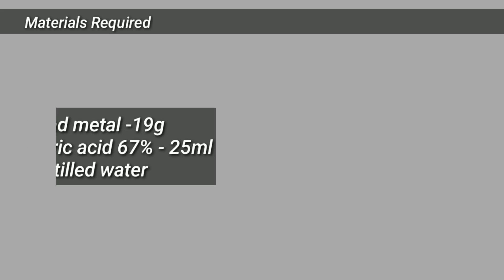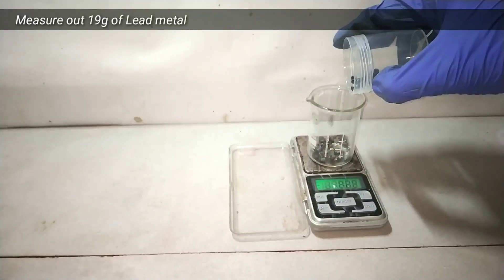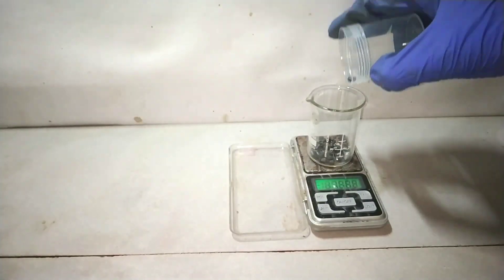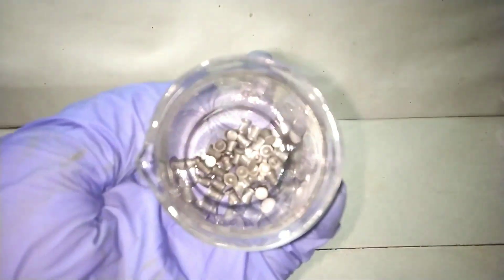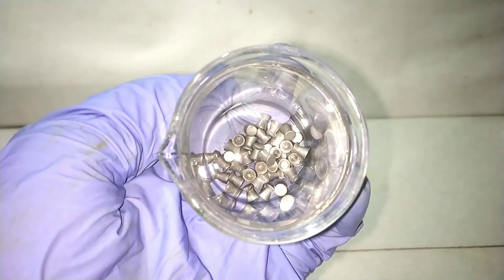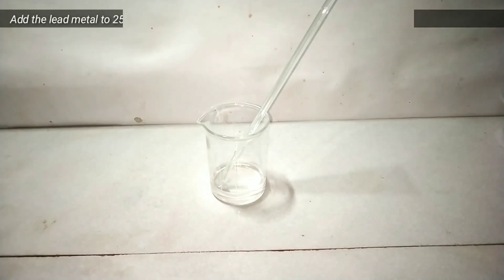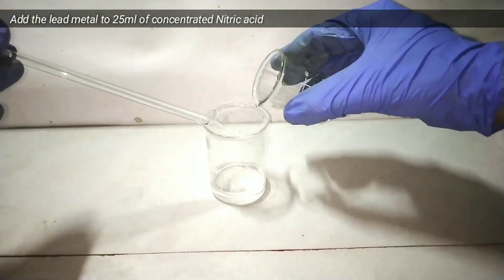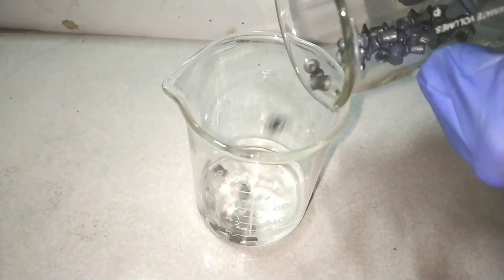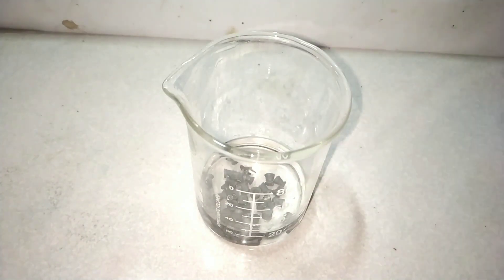The materials required include metallic lead and nitric acid. We start by measuring 19 grams of lead metal pieces. I am using some lead bullets which are used in air pistols. I am pretty sure they are mainly pure lead metal, so I am expecting a purer lead(II) nitrate salt. I have already measured out 25 ml of concentrated 67% nitric acid in this beaker. Now I add the lead metal shots into the nitric acid.